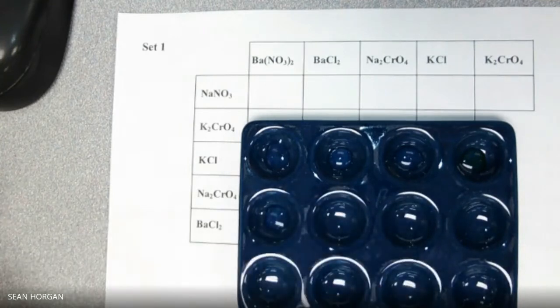And what I want to look for is one of the signs that a chemical reaction is taking place. Now, we're not going to get anything that blows up, so we're not going to get any kind of heat or light given off during the course of these reactions. And we're also not going to get any smoke or bubbles. We might see a color change, right?